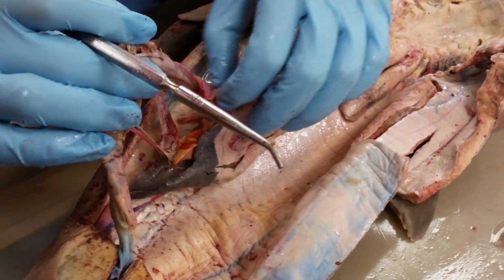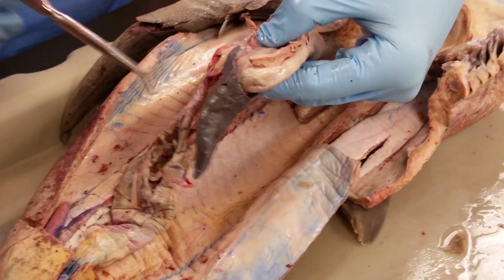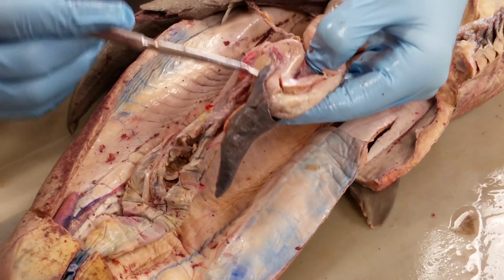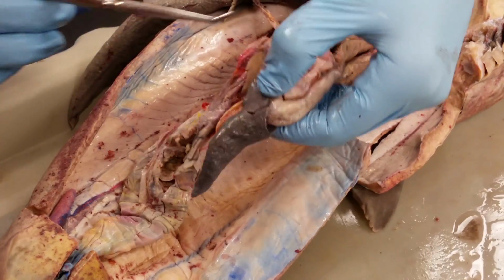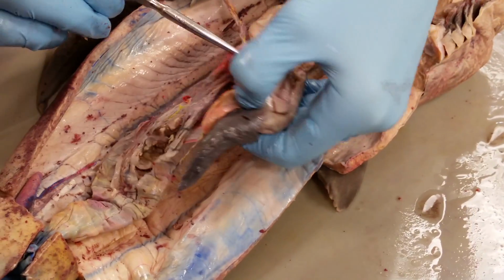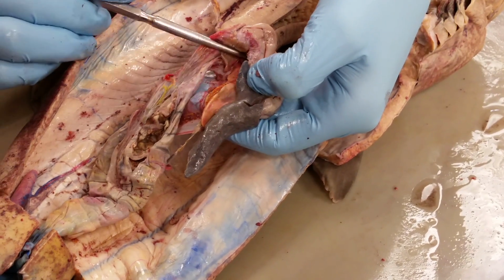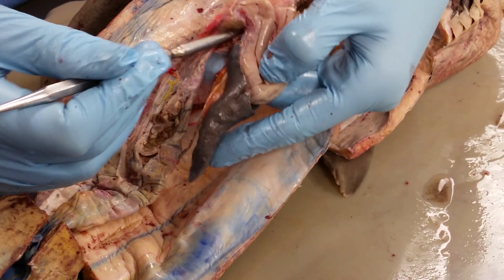On your duodenum here, you'll notice the ventral lobe of the pancreas kind of wraps around, and sometimes it goes back a little further, covering the duodenum right here. Okay, then underneath the pyloric region of the stomach and running towards the spleen, you have the dorsal lobe of the pancreas here. Okay, in sharks they have a third lobe, and it's right here.